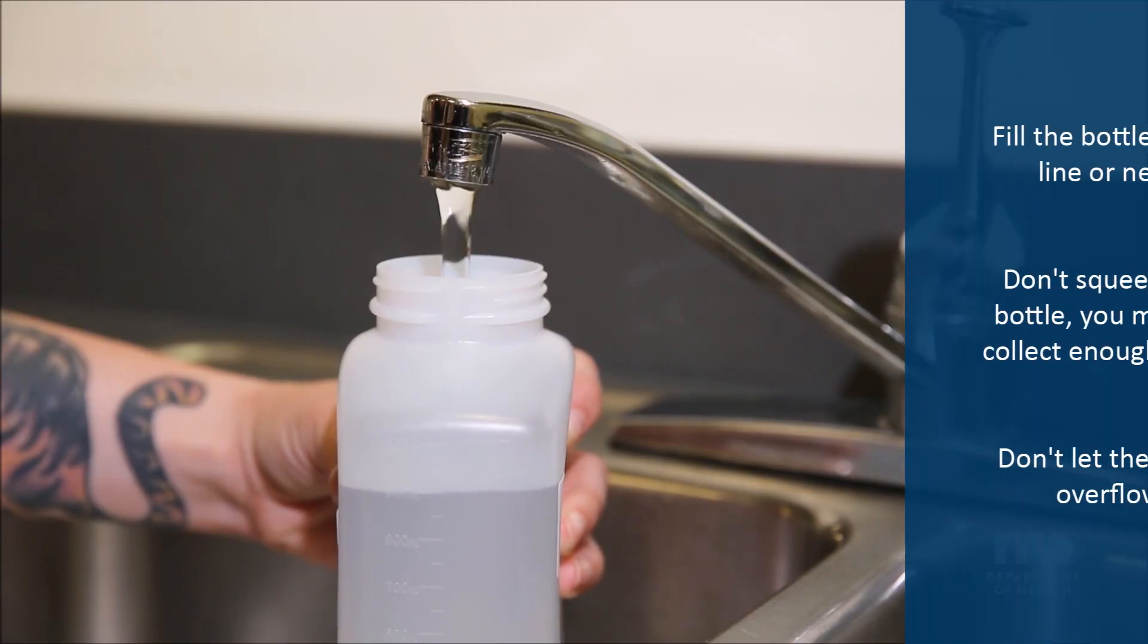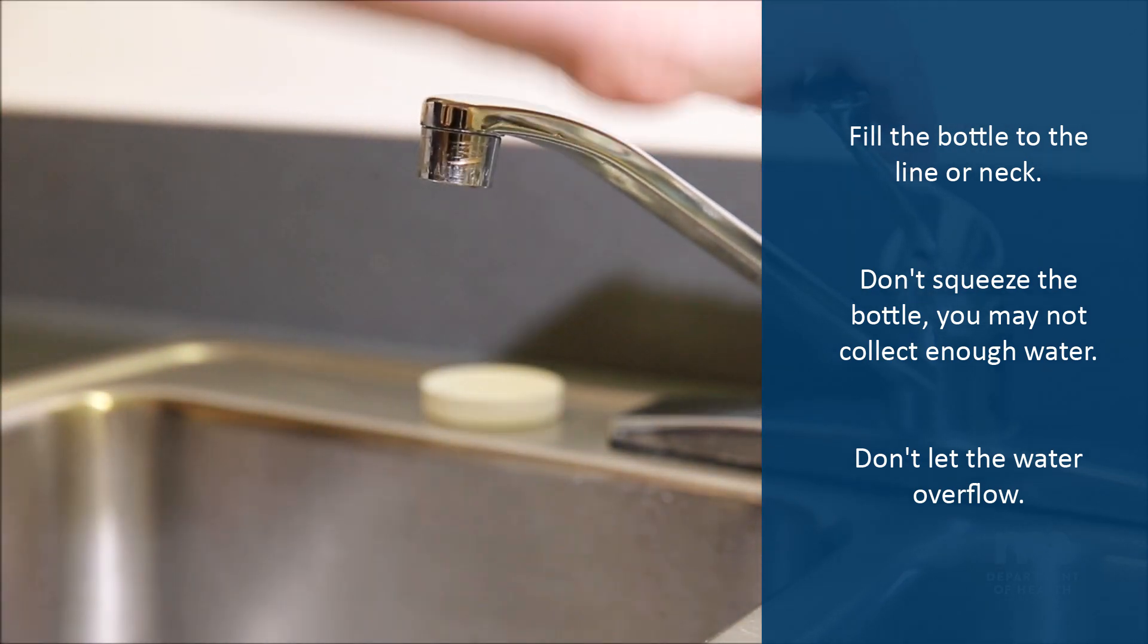Fill the sample bottle up to the line or the neck. The lab will not be able to use your sample if the bottle doesn't have enough water.